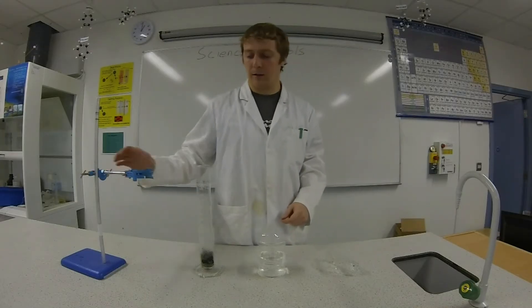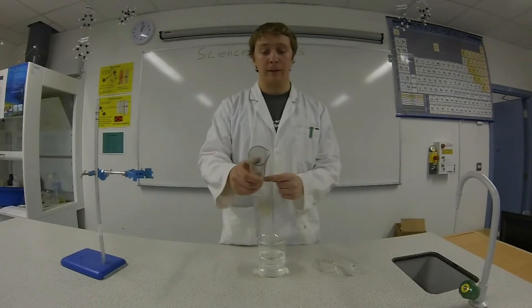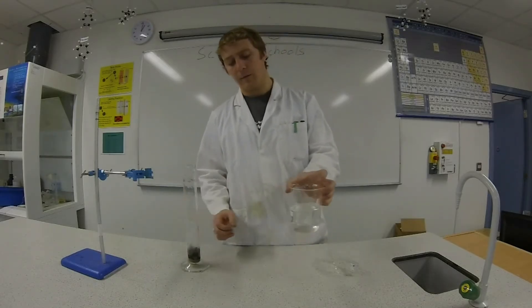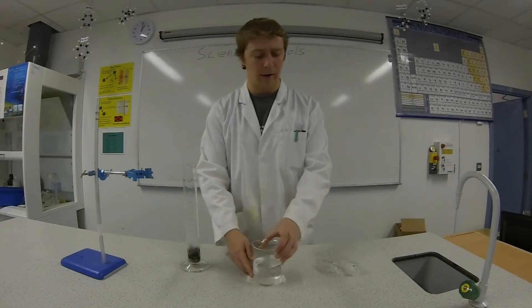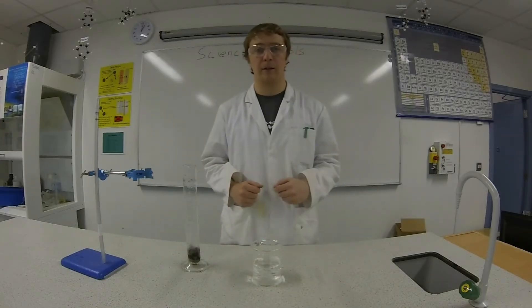You're going to need a retort stand, a graduated cylinder with some steel wool inside it, a beaker about half full of water, and always, most importantly, goggles on. You need your eyes to see the results.